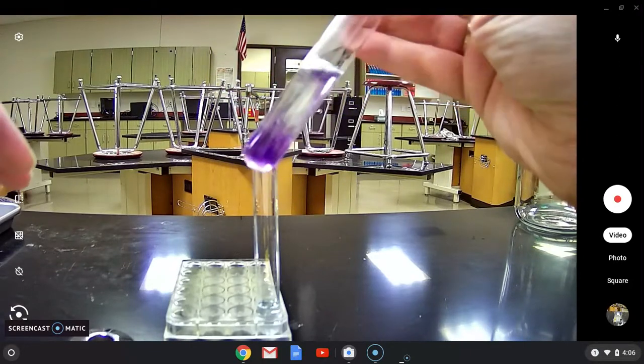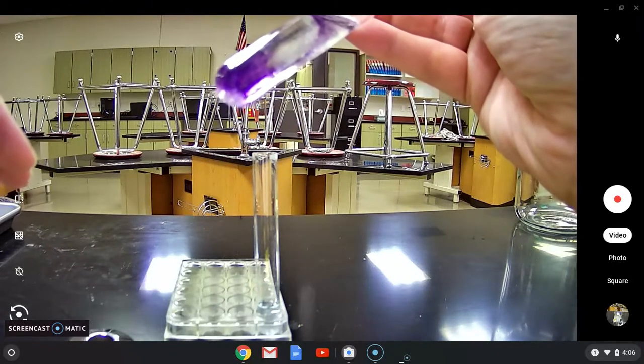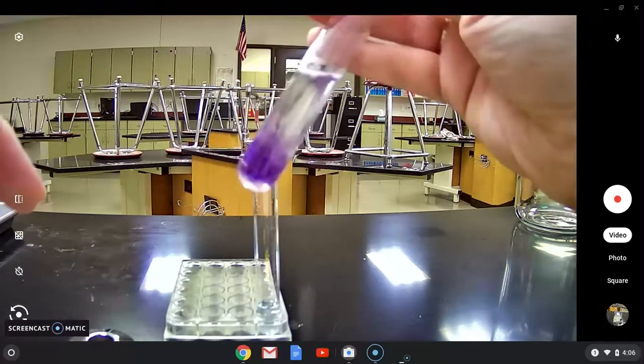Okay so that is your test for protein in a substance.